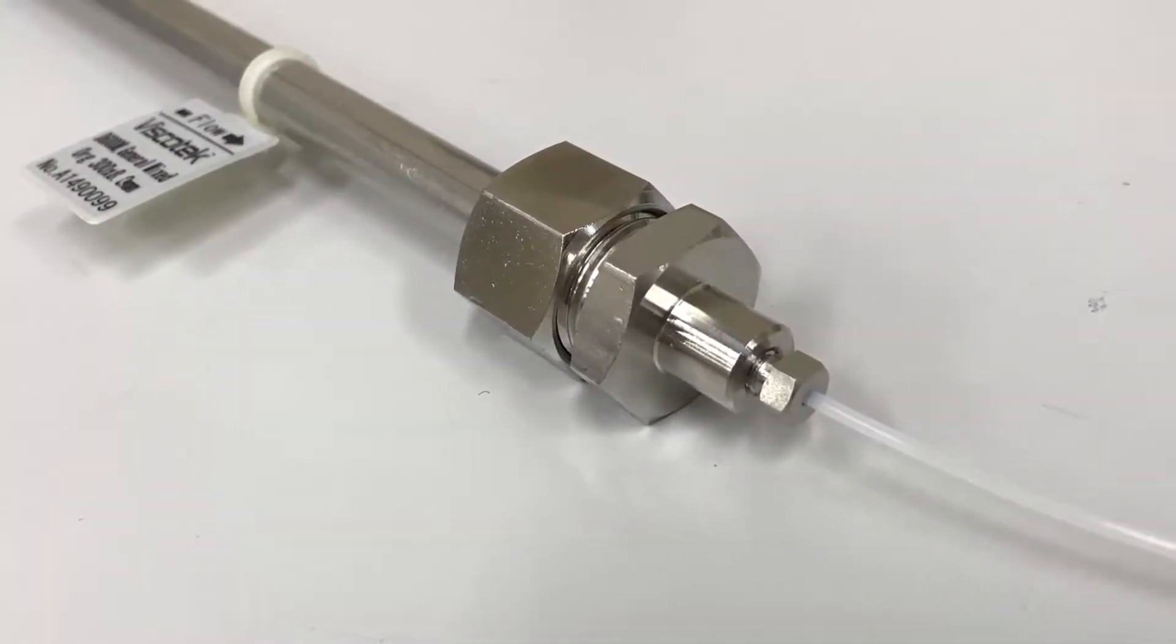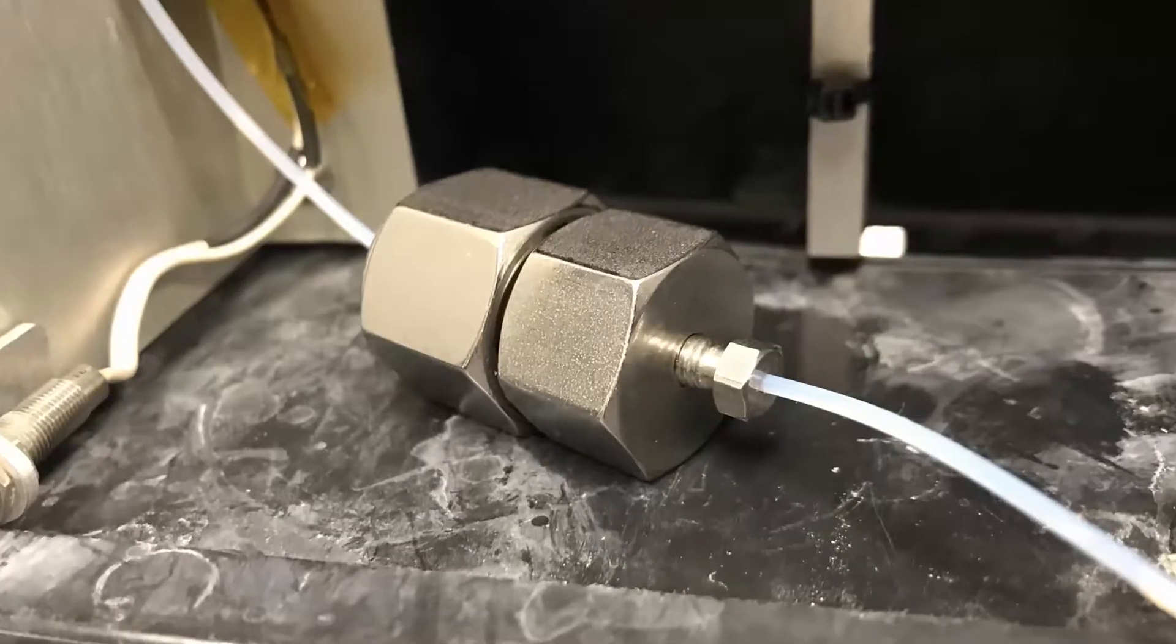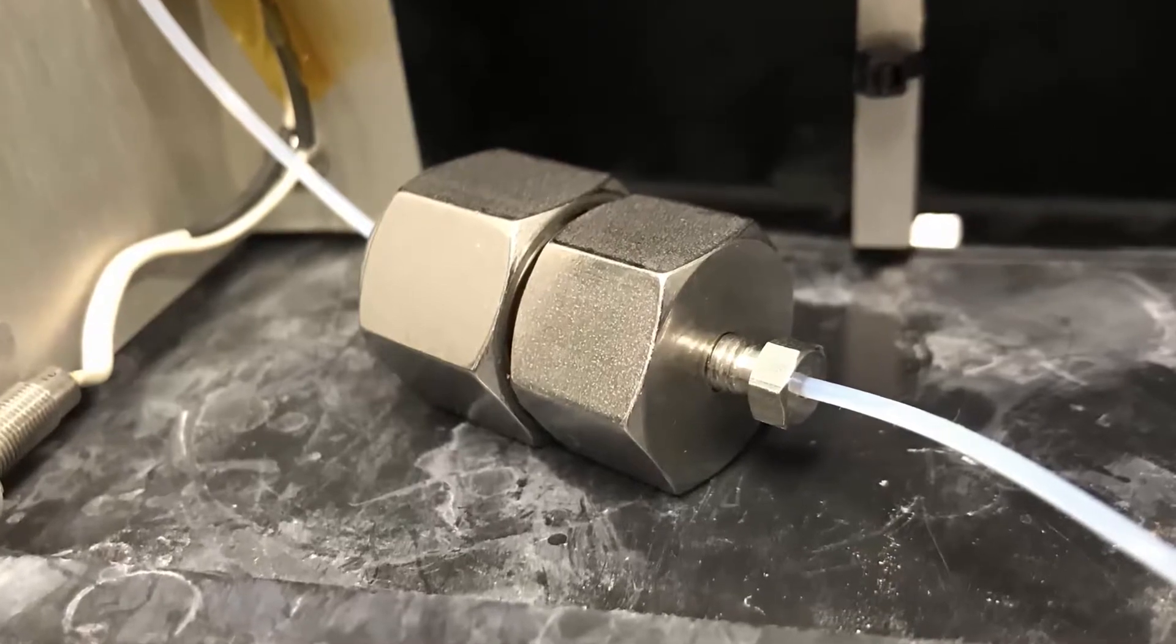Throughout your GPC instrument system, there are various fluidic connections that join one component to another, such as the column set, the post-column filter, and the detectors, to name a few.